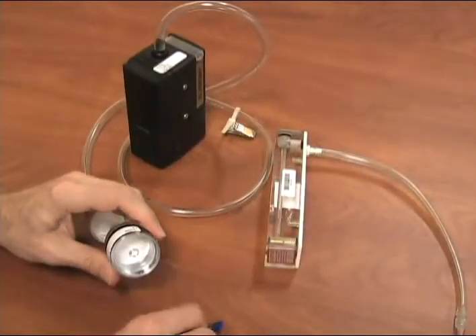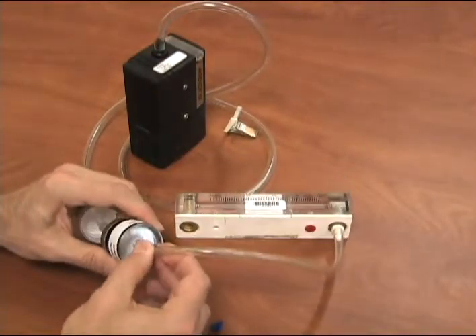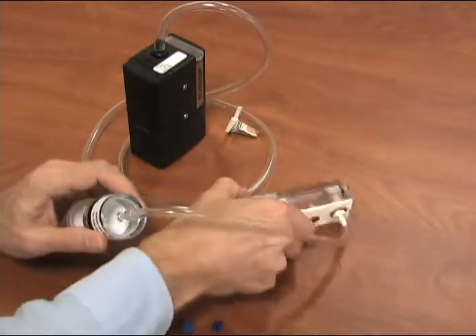Make sure the wagon wheel pattern of both cassettes are facing toward the pump. Remove the final nib and attach the rotometer.